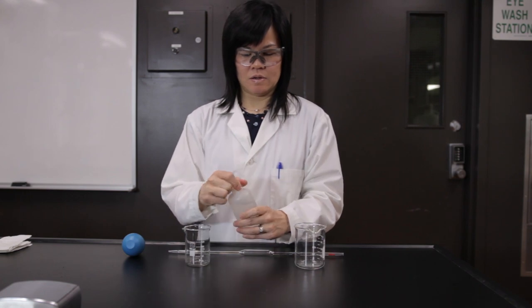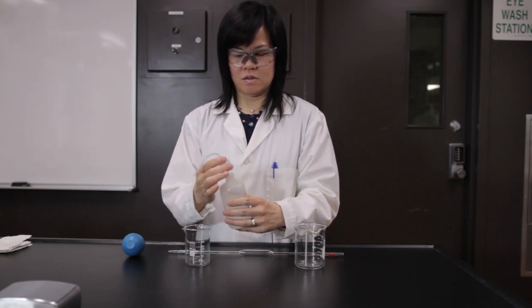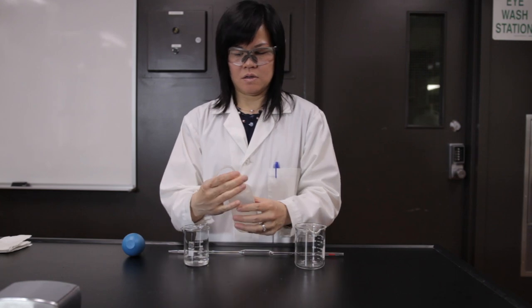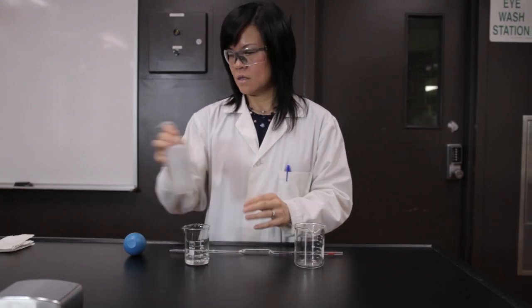Add distilled water into a small clean beaker. Prepare a 10 milliliter volumetric pipette. First, rinse it with distilled water two times.